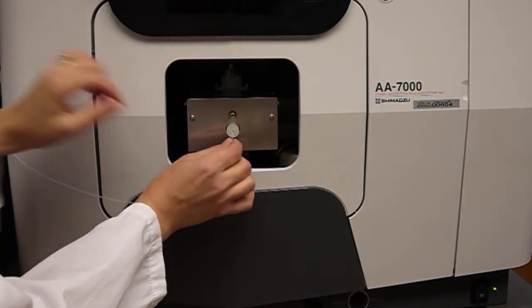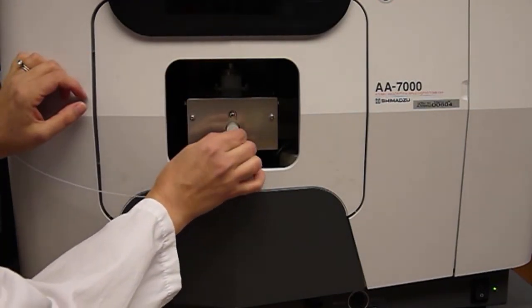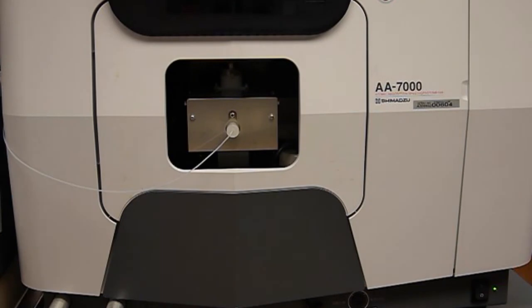This tubing goes on a little nebulizer inlet, just like that.